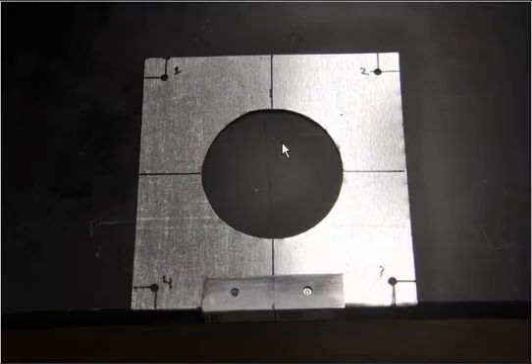So then I have my plate, I'm going to line it up in the center, and then I'm going to mark two holes in the plate so that I can fit it in the bracket. I've just set the plate at the edge of the desk so that the holes line up with how it's going to sit when it's all put together.